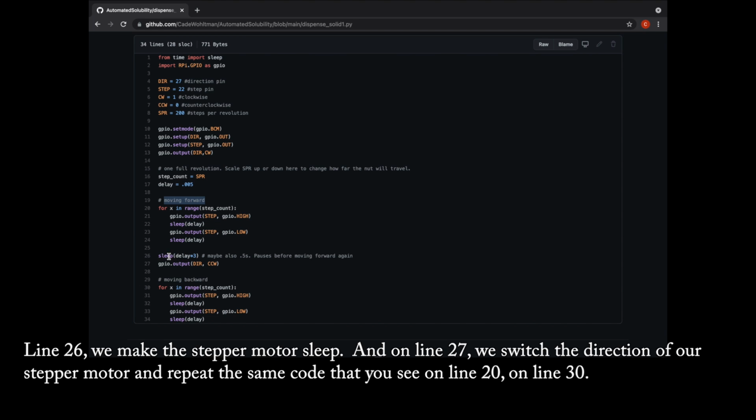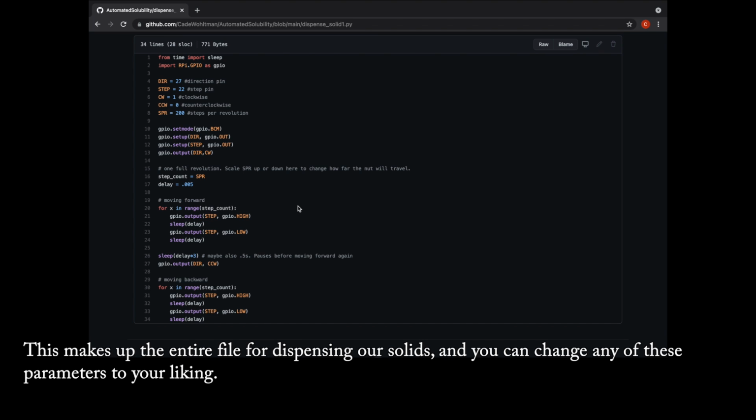Line 26, we make the stepper motor sleep, and on line 27, we switch the direction of our stepper motor and repeat the same code that you see on line 20 on line 30. This makes up the entire file for dispensing our solids, and you can change any of these parameters to your liking.